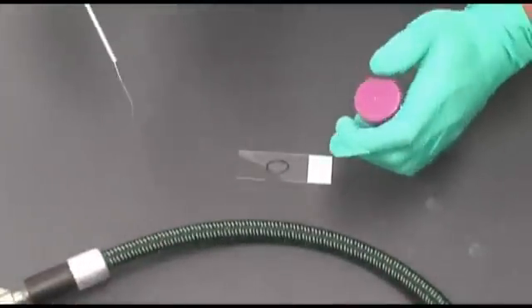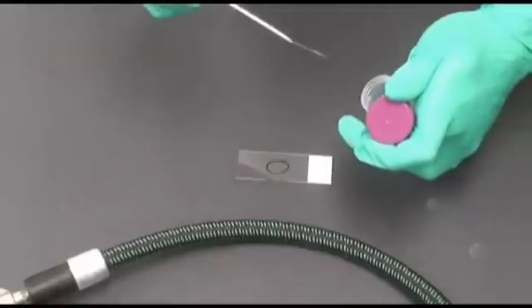A drop of water from a sterilized wire inoculating loop is placed inside the wax circle. Water allows the bacteria to be smeared appropriately.